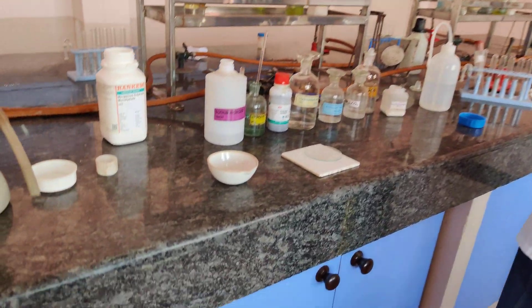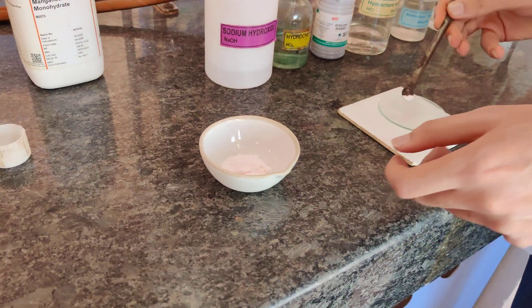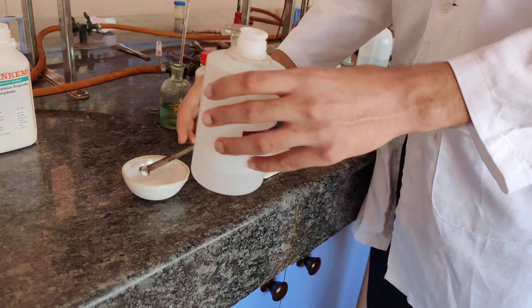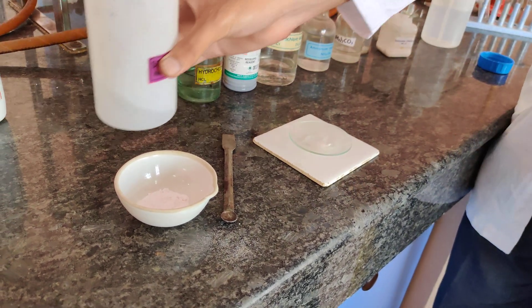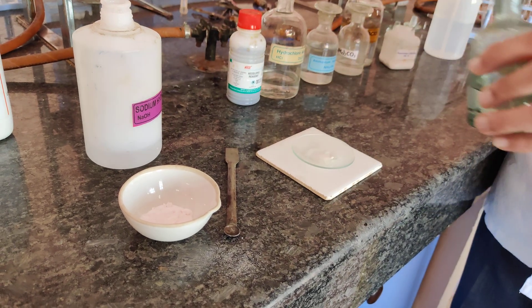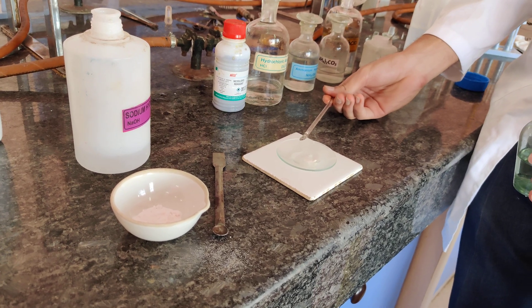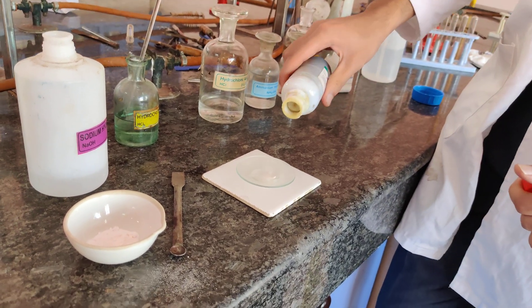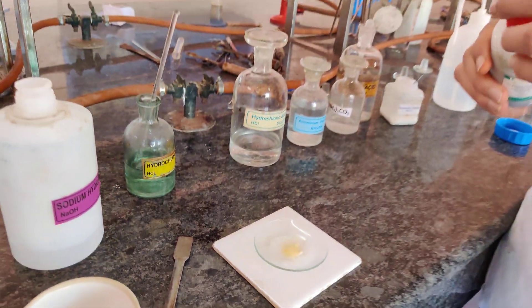My student Tokir will be performing the practical. We begin with the zero group test first. He will take a pinch of salt, add NaOH, then bring a glass rod dipped in concentrated HCl near the solution. You can see there is no gas involved. He will also add a drop of Nessler's reagent to cross confirm, and you can see there is no change.